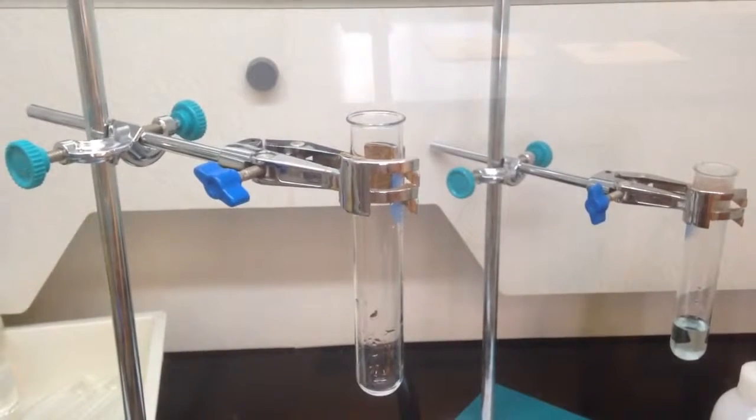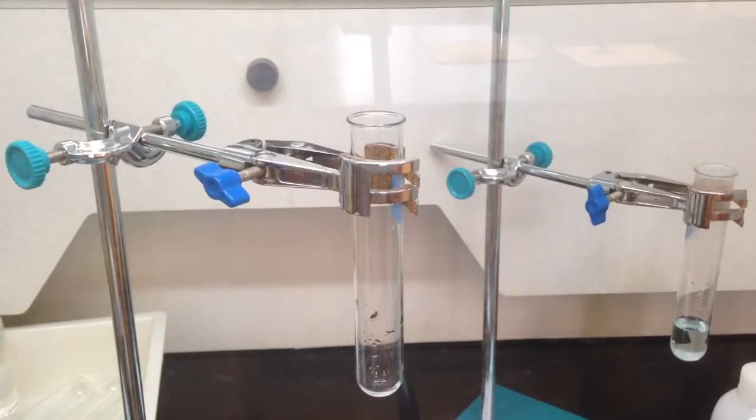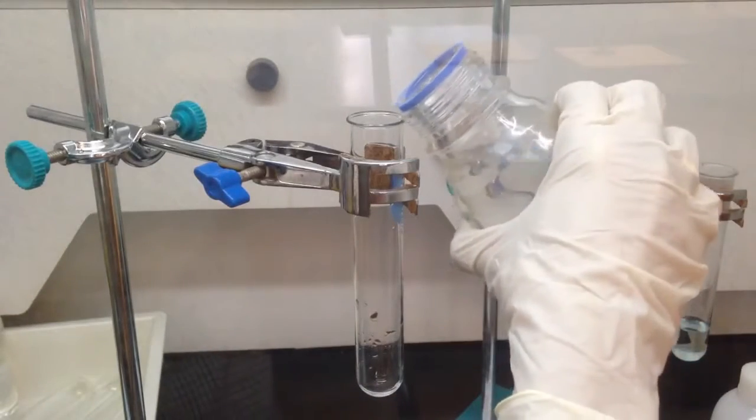So in this video, I would like to show you how copper metal reacts with concentrated nitric acid. Concentrated nitric acid is known as a strong oxidizing agent. That means it can oxidize others very easily. So let's look at it.